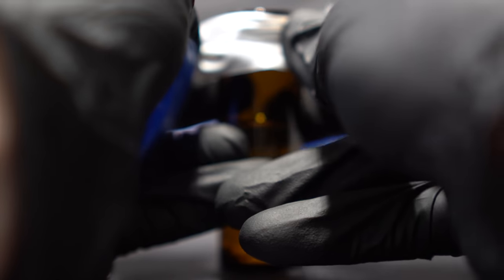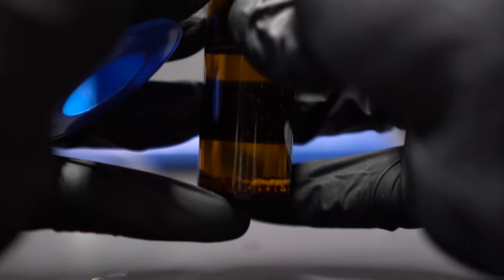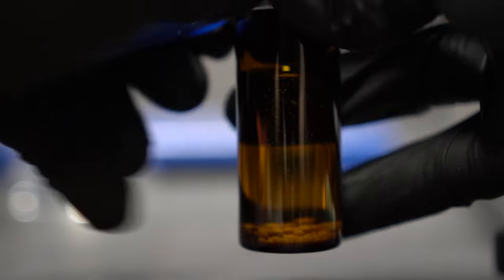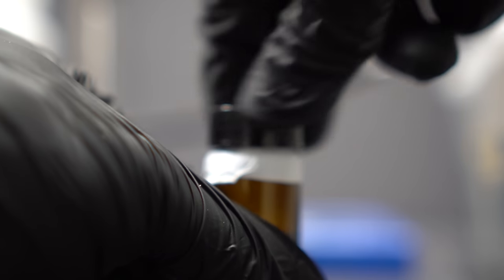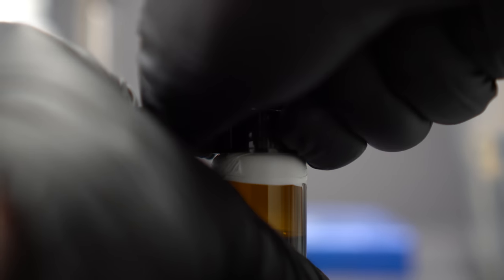You can also turn this into pyridine HCl by pouring the pyridine into ether and bubbling HCl gas into it. It is extremely hygroscopic, so it's really not easy to store.